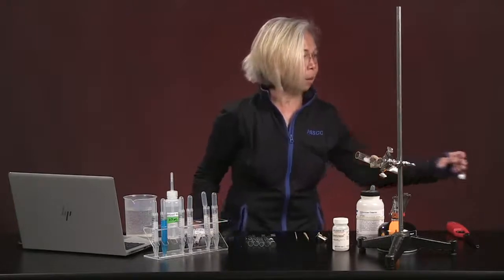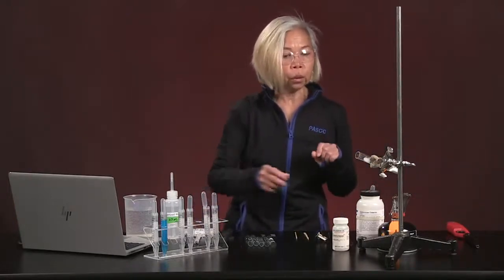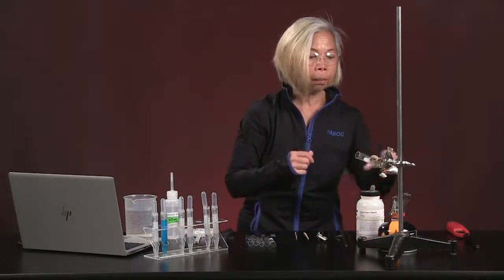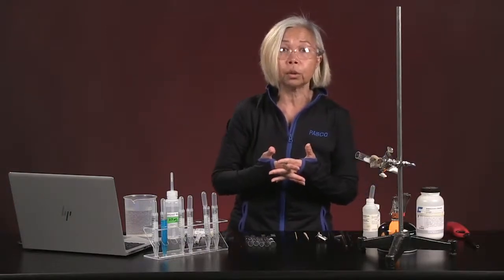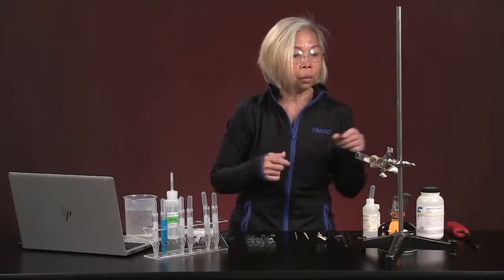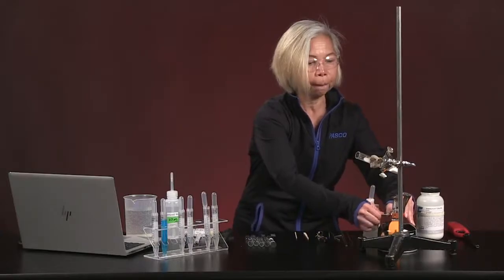That is experiment A. For experiment B, we are going to be heating up our sample of sodium bicarbonate. Now remember, we could have used copper(II) carbonate, which is what is written in your lab, but we didn't have any. So today we're going to be running this experiment using sodium hydrogen carbonate.